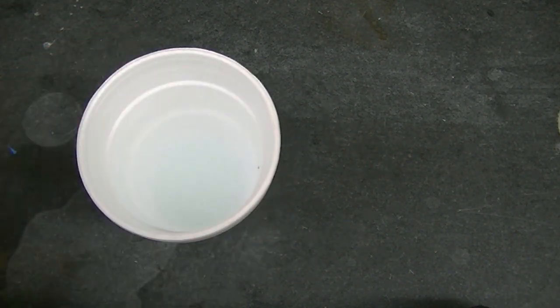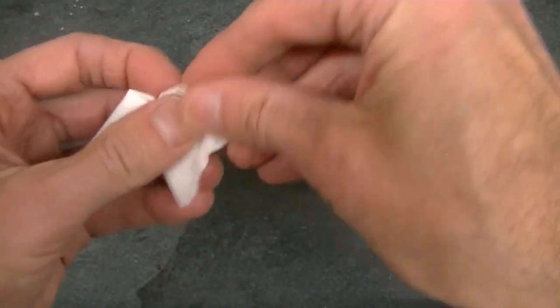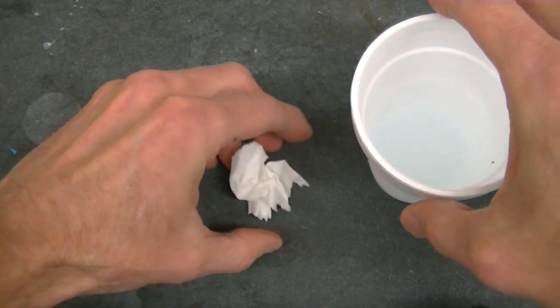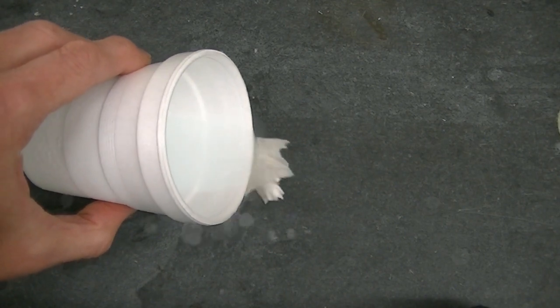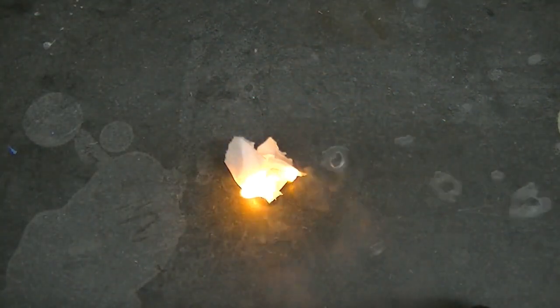Let's see how liquid oxygen does. Once again, I'll take a combustible paper towel and fold it up. We'll put a little bit of liquid oxygen on top. And try to light it with a... Oh man, that works pretty well.